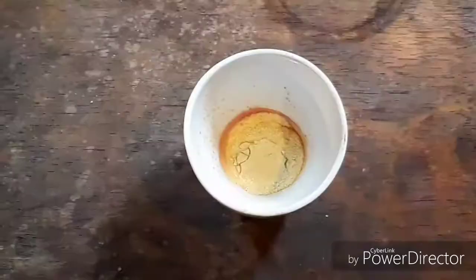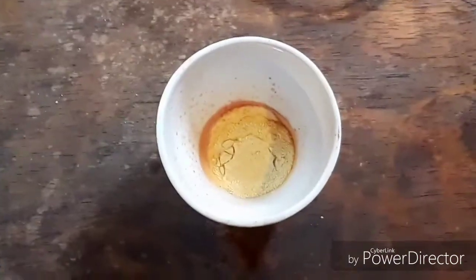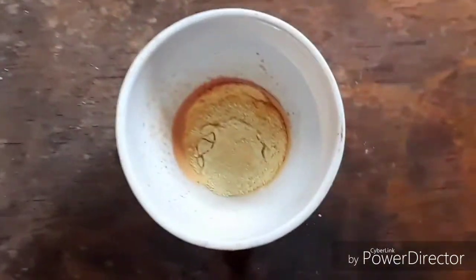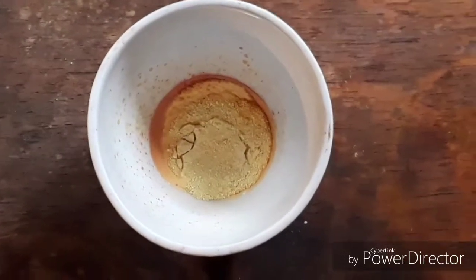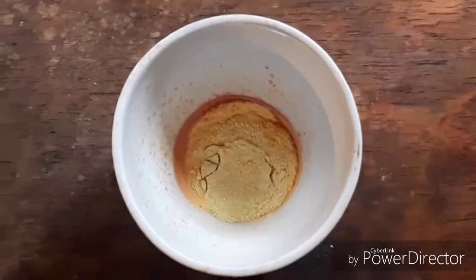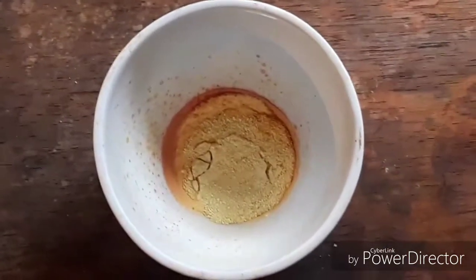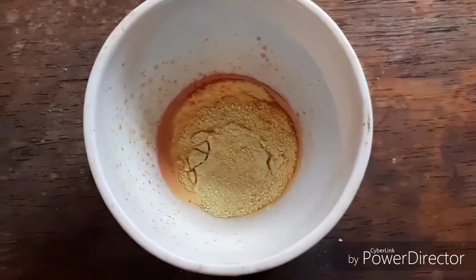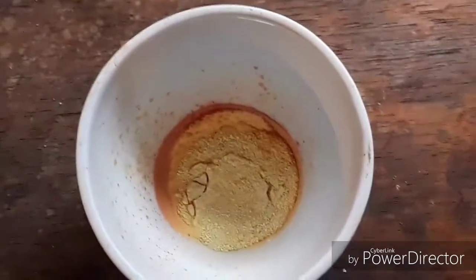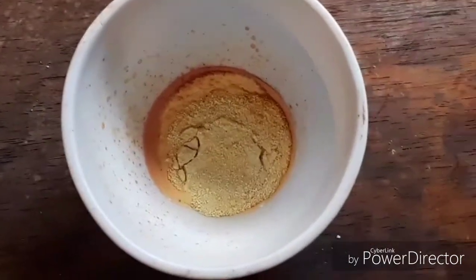It took about 15 minutes and our white lead nitrate has converted into what you see there — that is lead(II) oxide. This is pretty much ready for use. All that needs to be done is it needs to be taken and scraped out of the crucible carefully so that you don't crack the crucible. It's pretty easy to get out.